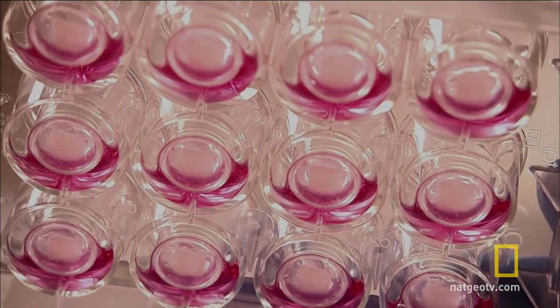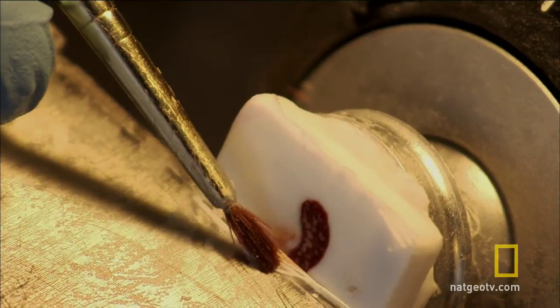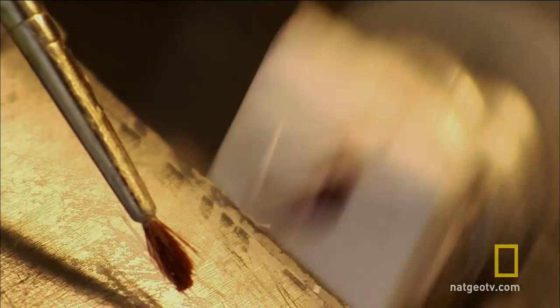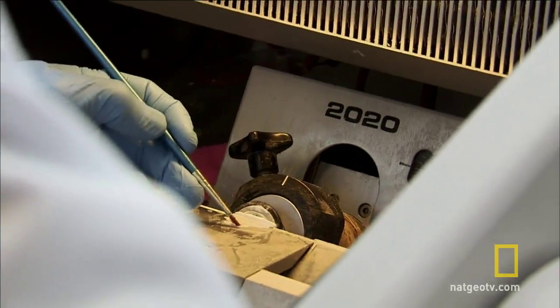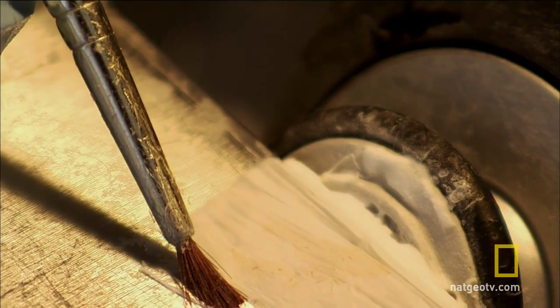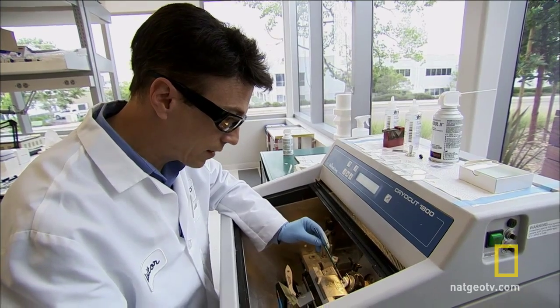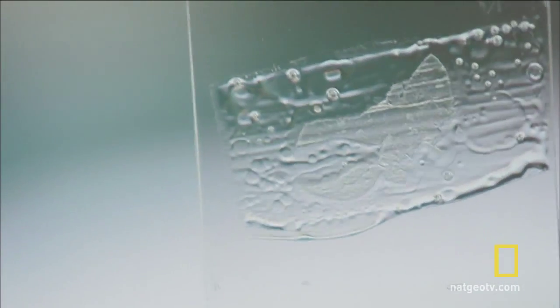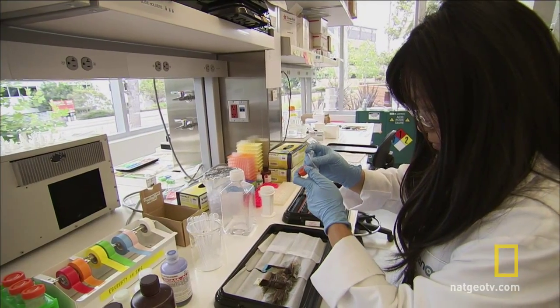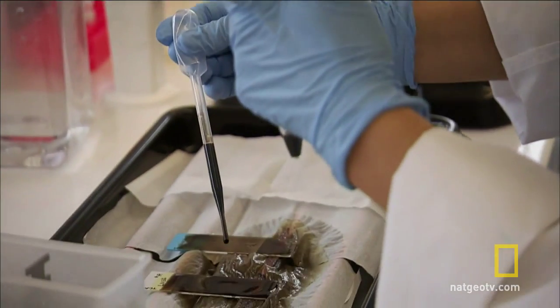The question is, how close a match is the printed tissue? I'm taking a cross-section of human liver to make a comparison. It's a very delicate, thin material, and I'm making five microns thick. That's about one cell layer. And once it's layered on the slide, I can stain that, put that under the microscope, and see what we've got.